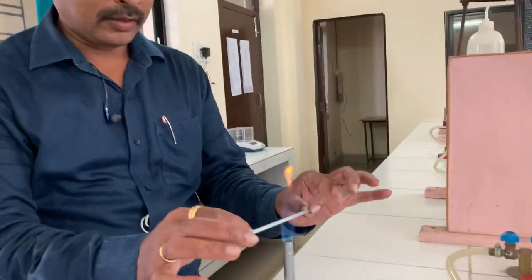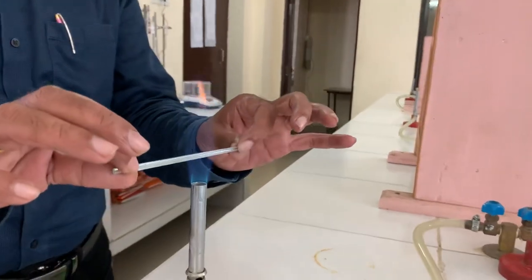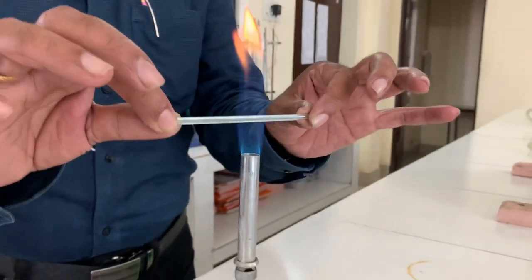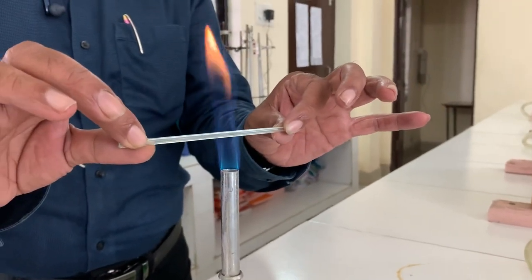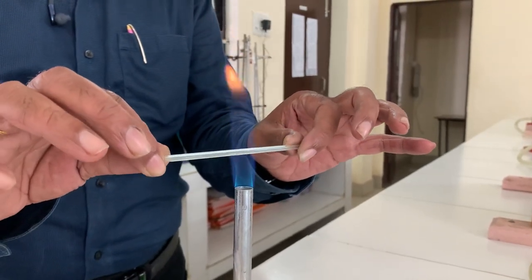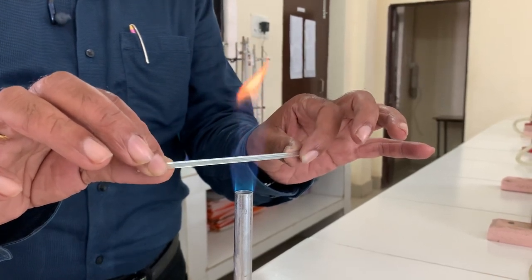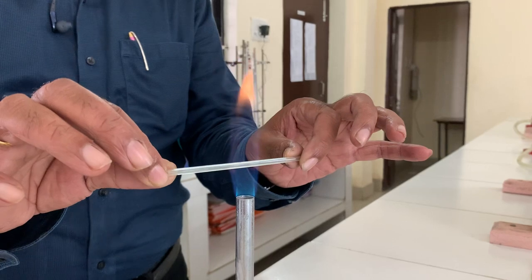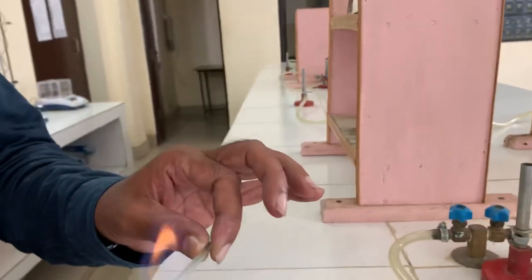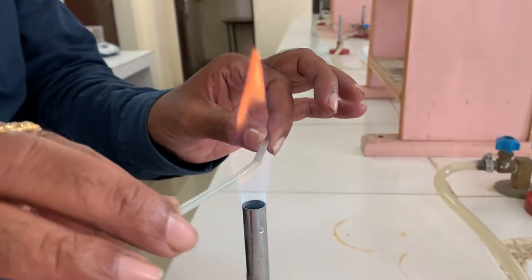At the middle, you move the tube — not in one place — and you press your fingers toward the inside, not outside. Towards you. Then gradually, slowly, slowly bend the tube. Not suddenly — if you suddenly bend, then it will break.